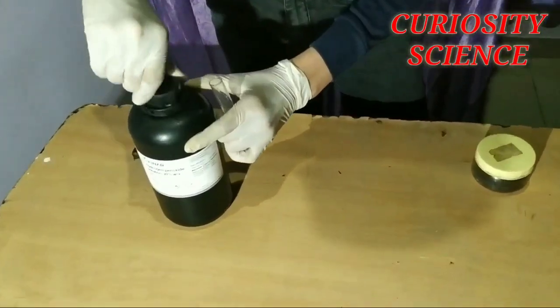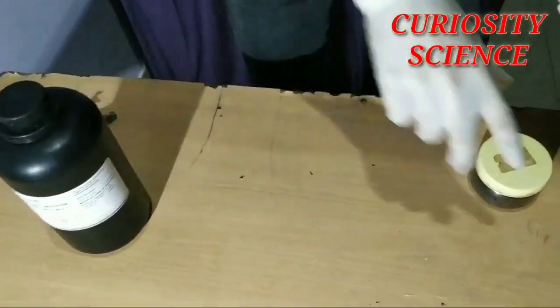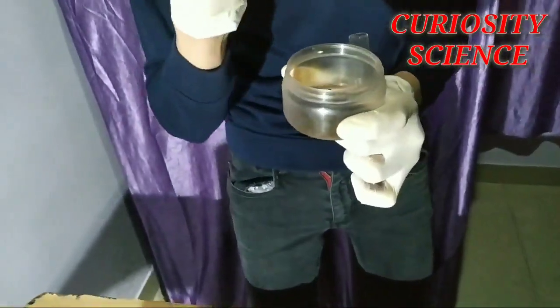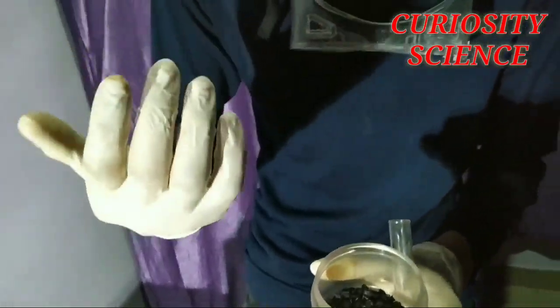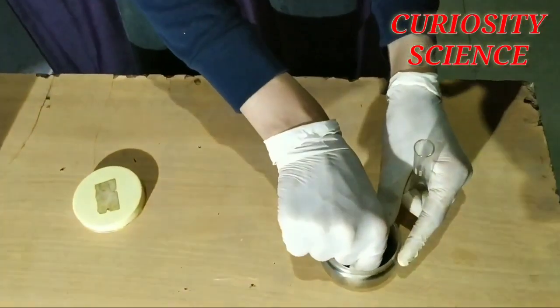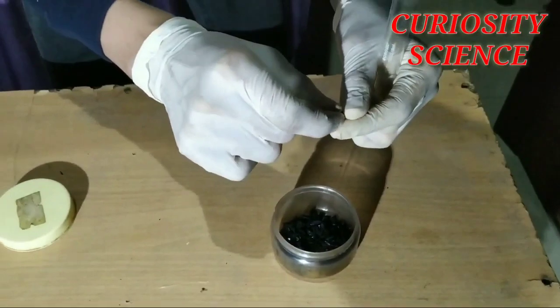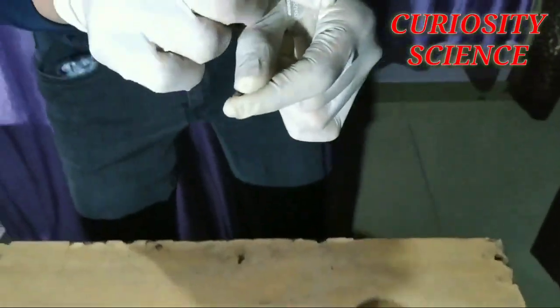Now we are going to add potassium permanganate — just a small crystal, a little bit, and we will see what happens. You can see how small this crystal is. When you add potassium permanganate, you will see how much reaction occurs.